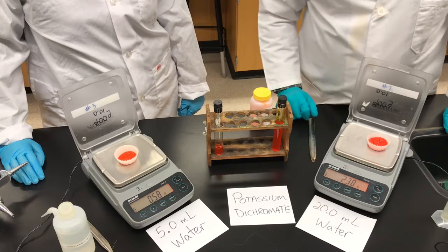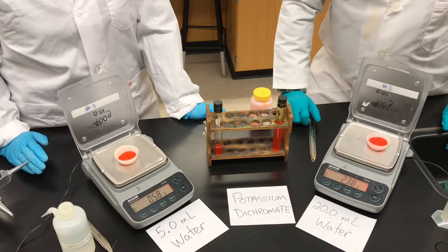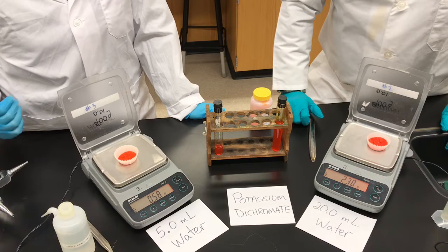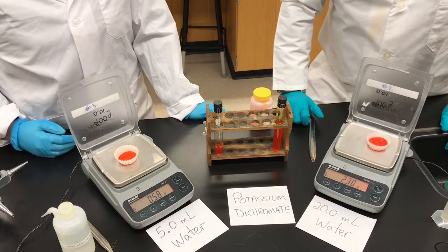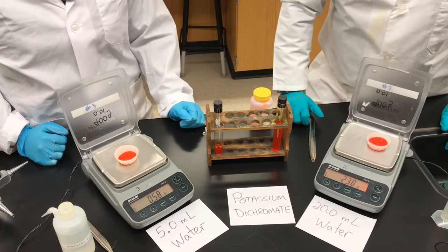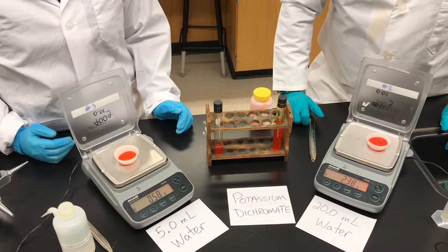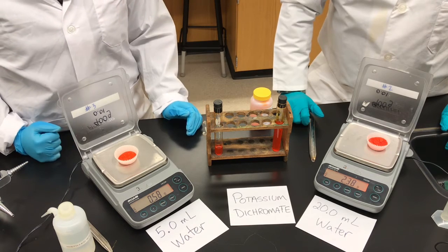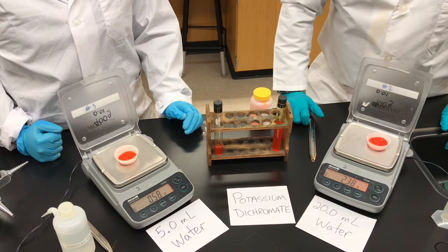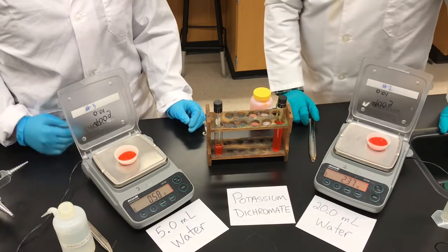I added 2.38 grams to my 20 milliliters of water, and Mrs. Watts added 0.58 grams to her 5 milliliters of water. Comparing these, you can see there's about 4 times as much mass added to the 20 milliliter test tube compared to the 5 milliliter test tube — and that makes sense, because we had about 4 times as much solute added and about 4 times as much volume of solvent.